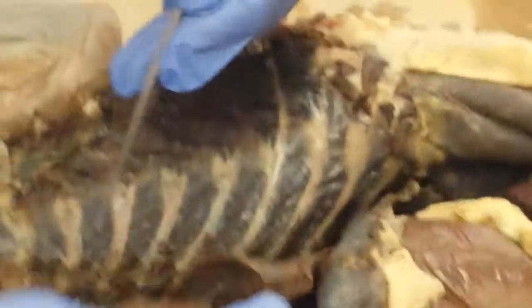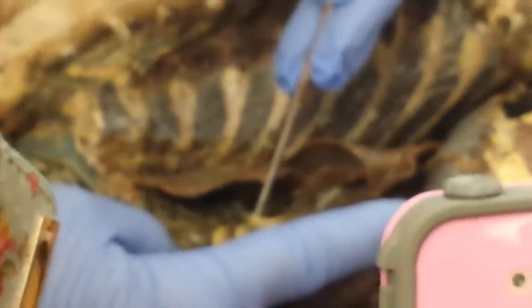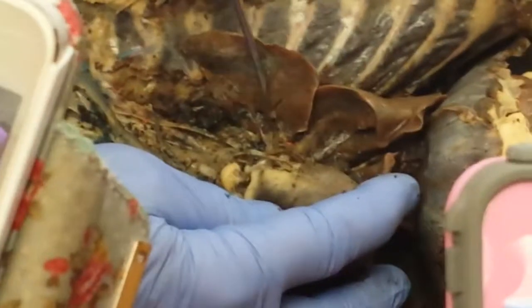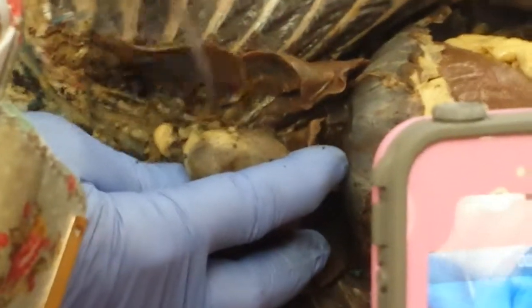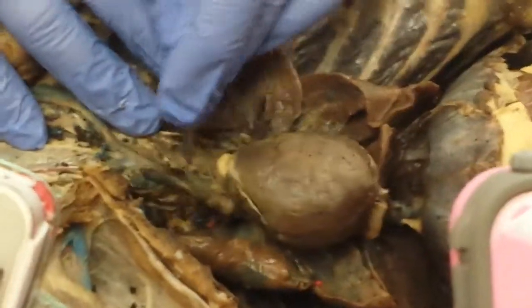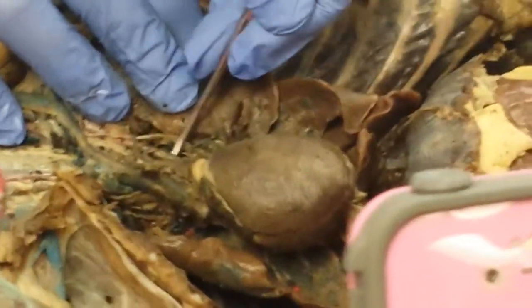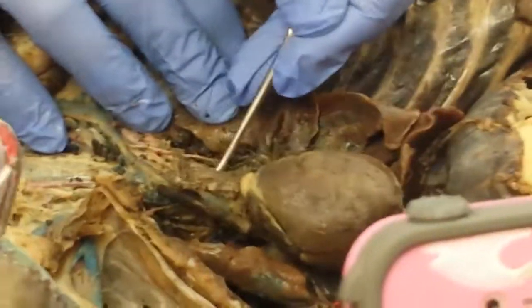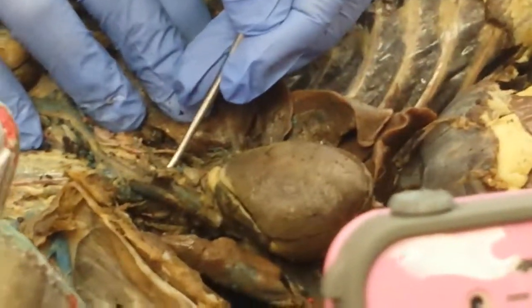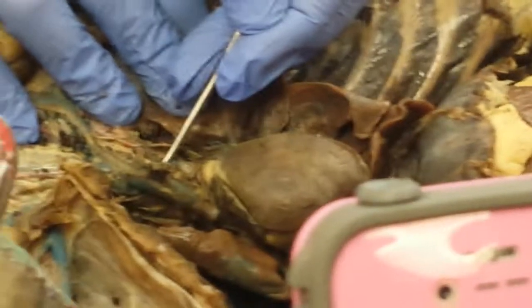So moving on, the next major trunk you're going to find behind the pulmonary trunk, or the main pulmonary artery, is what? The arch of the aorta. Fat tag denotes the arch of the aorta right here. Now what you want to observe on the arch of the aorta here is that in the chest it has two main branches or tributaries. The first one off of the arch of the aorta is called what? The innominate or the brachiocephalic artery.